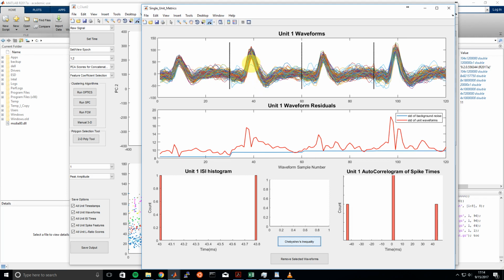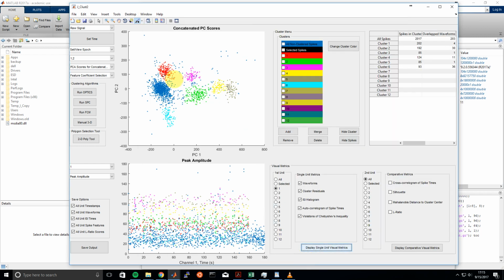One last thing we can do is maybe select some of these. There might be a few waveforms here that we might identify as false positives. So this is being extra picky, but just for the sake of example here, I'll choose a few waveforms using the brush tool, and I'll keep shift selected so I can select multiple waveforms at a time. And then if I go down to this remove selected waveforms button, those waveforms will actually pop up in the J_Clust2 main GUI, and then I can remove them from that particular cluster as shown here.